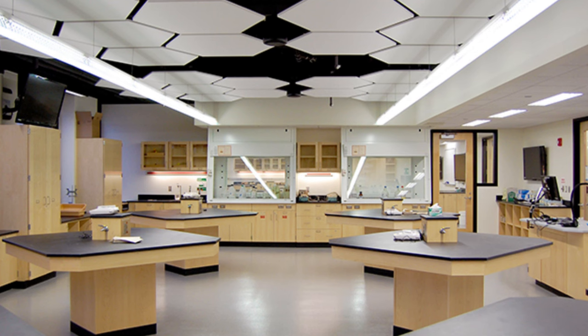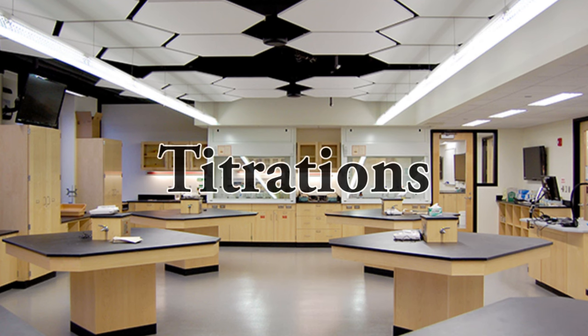Welcome to the UNL Chemistry Department. In today's video we are going to be looking at the proper technique and procedure for titrations. Let's get started.